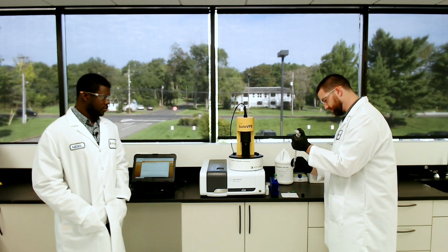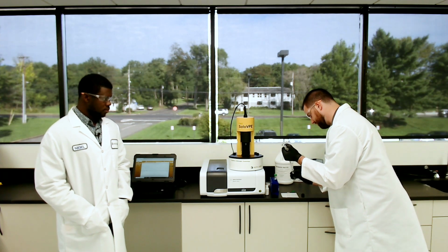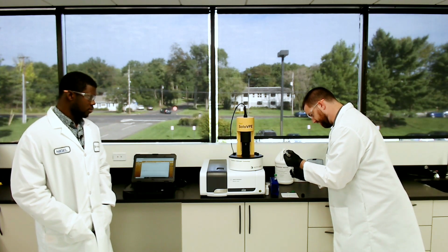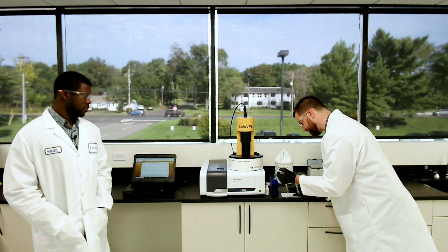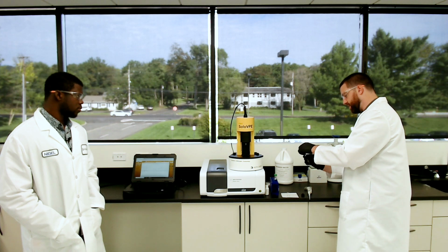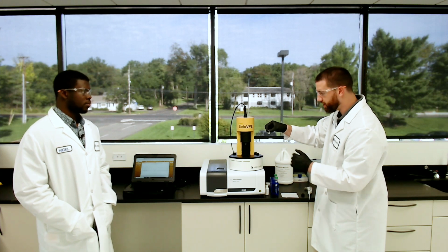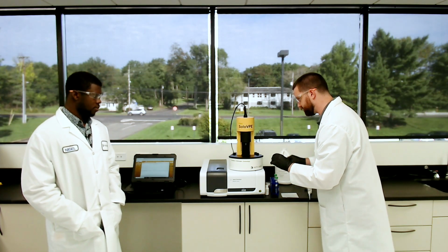So I'm going to go for 3 aliquots of 800. And the idea is to have around 2.5 milliliters. Anywhere from 2.2 to 2.5 should be okay. All we're really trying to do is make sure that the liquid height inside the vessel is going to be 15 millimeters in height so that our fibrette can use all 15 millimeters of that liquid height to evaluate the absorbance.